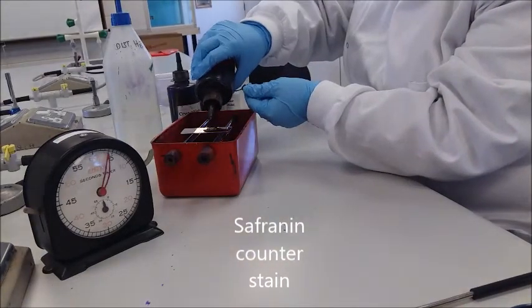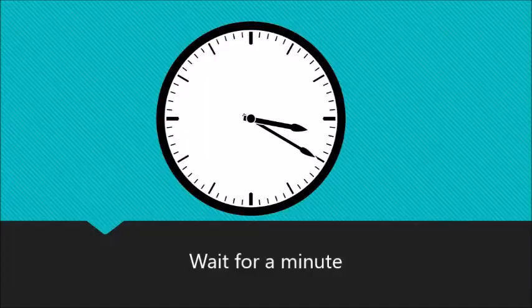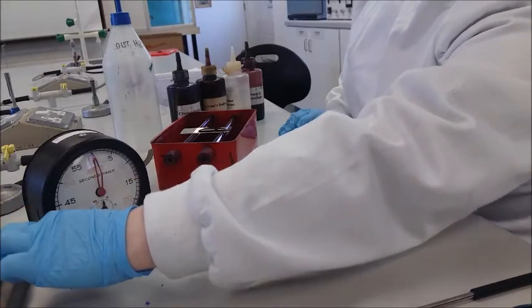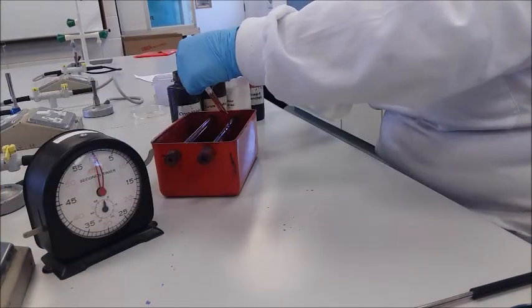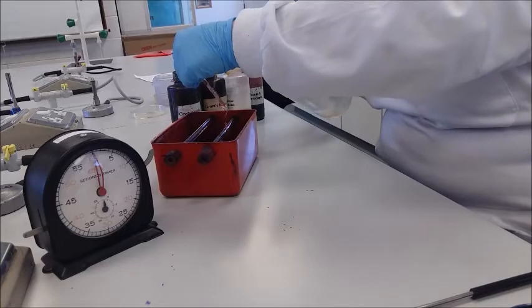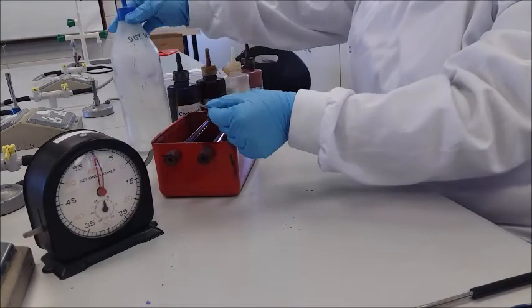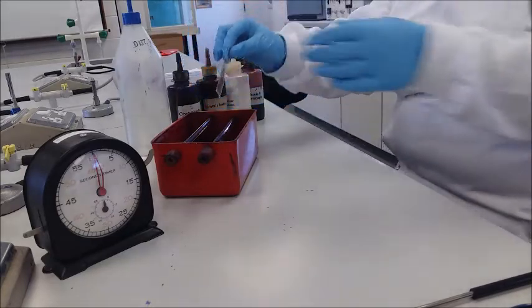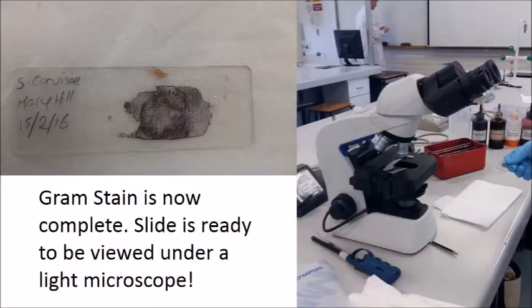Tap off any excess water and blot dry. Add safranin counter stain and leave for 60 seconds. You have now successfully carried out a Gram stain procedure.